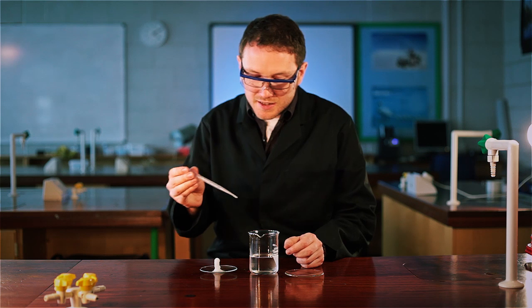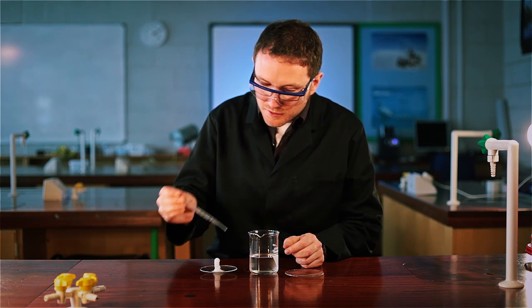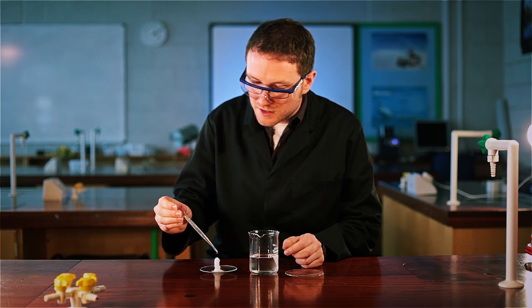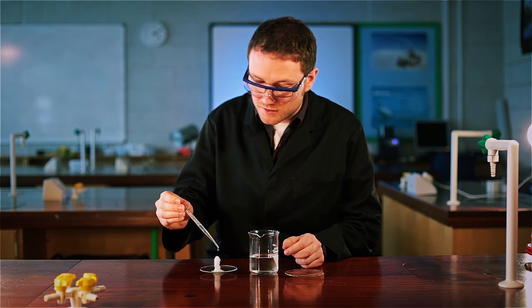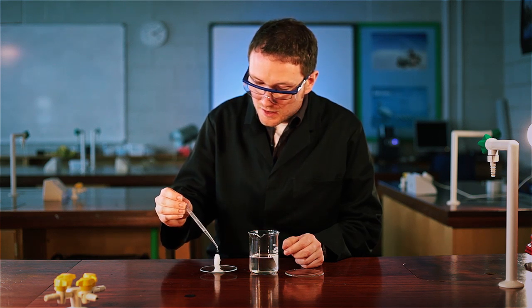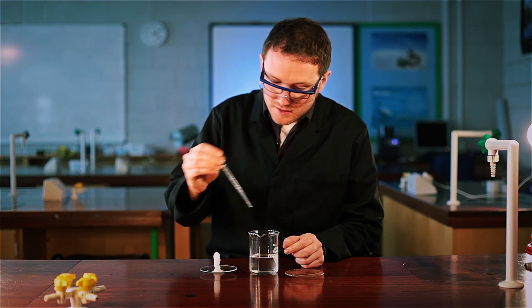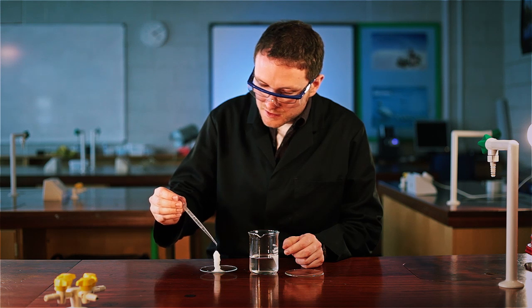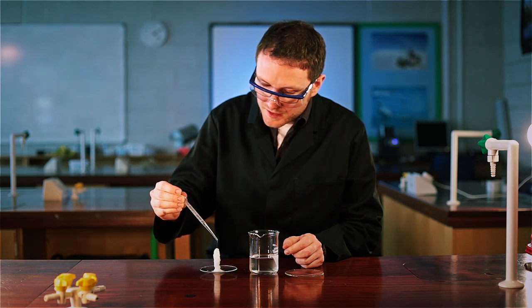I find it's quite handy to actually split down my stock solution so that if something goes wrong, then I've always got something else to fall back on. And I find that I get asked for this quite a lot because students really enjoy watching these things form.